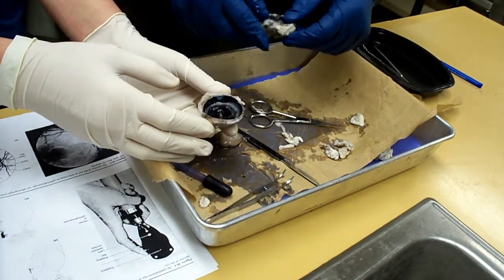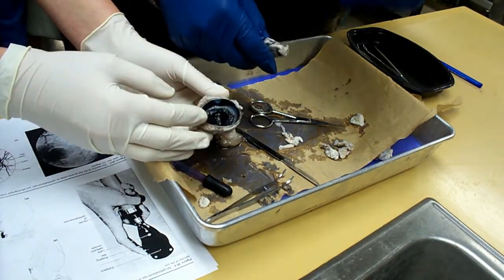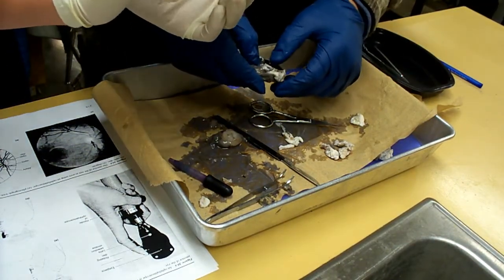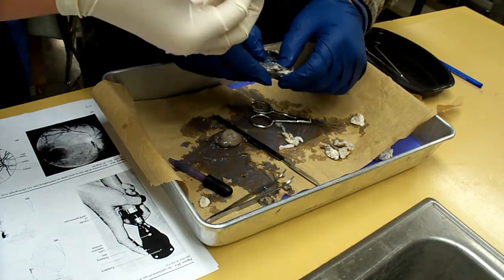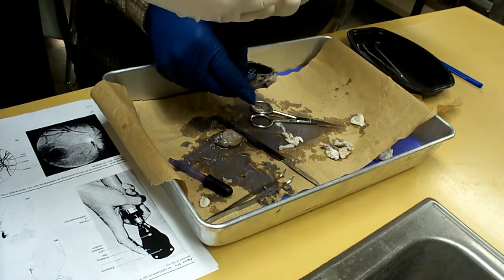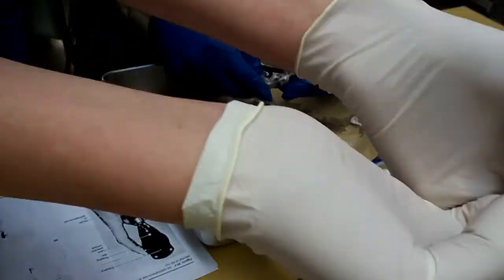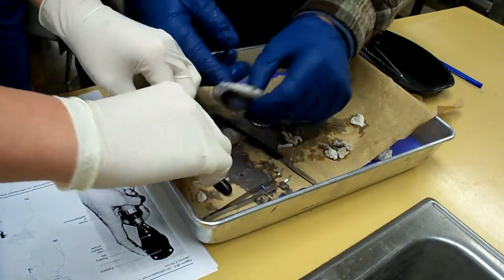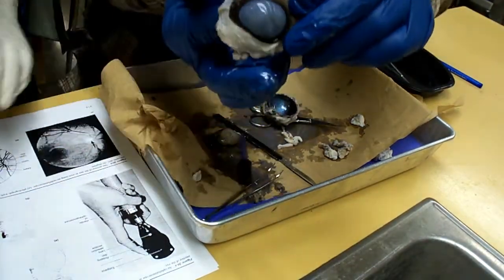Cornea, it's all faded in there. This is the iris all around. Okay guys, we got about ten minutes. Eight minutes before we start putting stuff back. You got another eight minutes. Folks, answer those questions on the band sheet. Don't forget those.